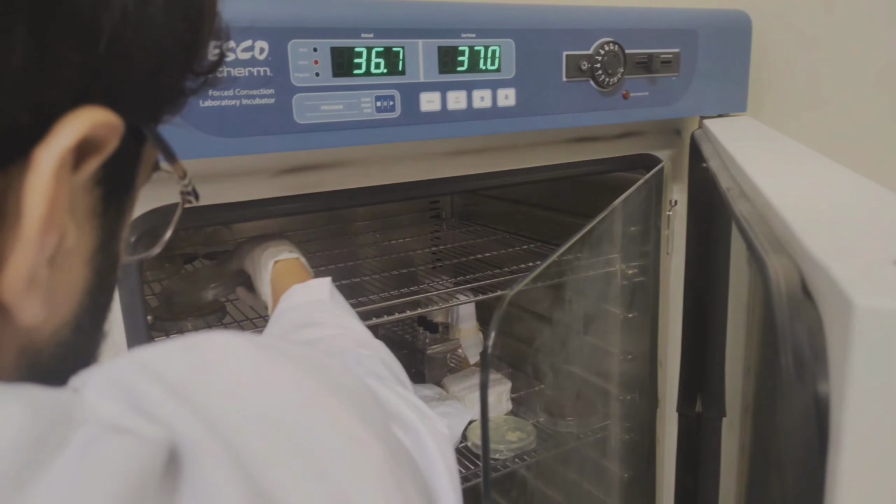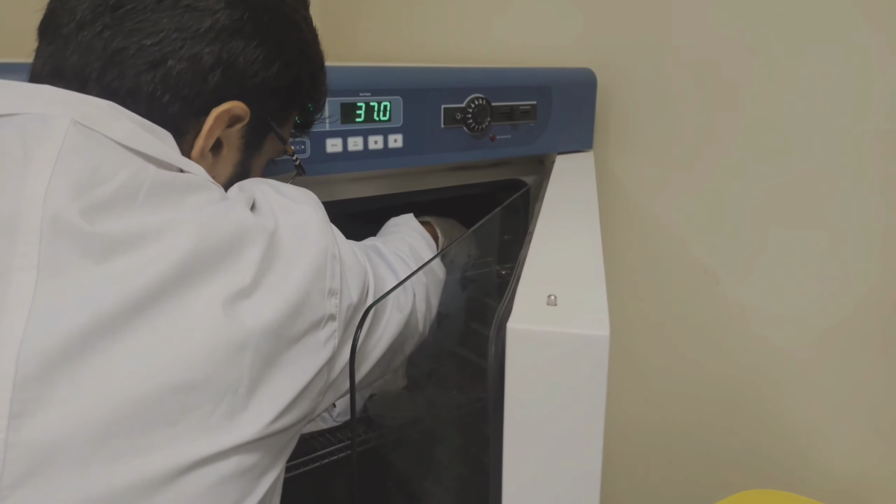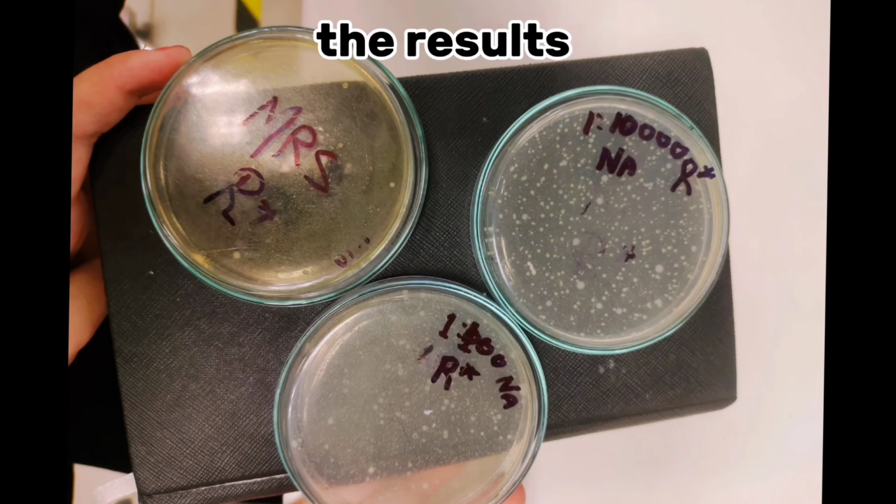Now we will place our plates in incubator at 37 degrees Celsius temperature for 24 hours. Now finally we will count the colony forming units after 24 hours of incubation. Make sure the colony forming units should be between range of 30 cells to 300 cells. Then we will put number of colony forming units in a formula to find colony forming units per ml in our dilutions.